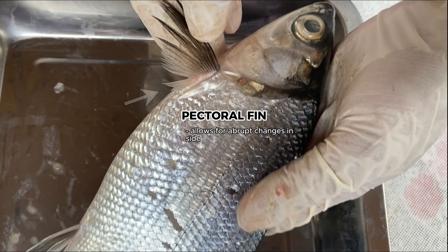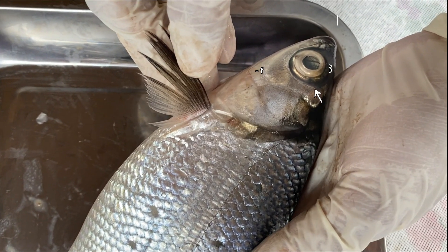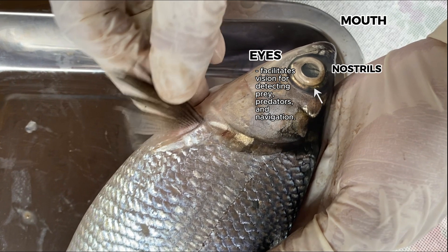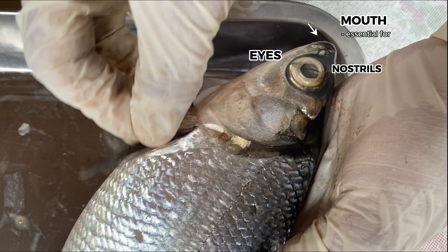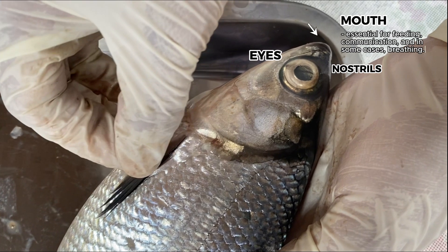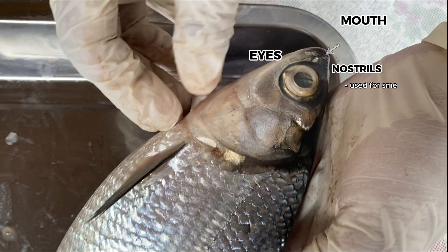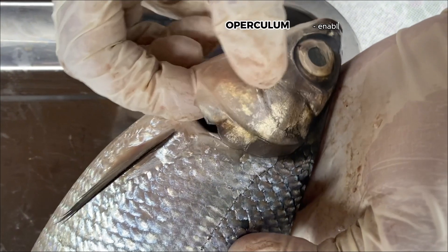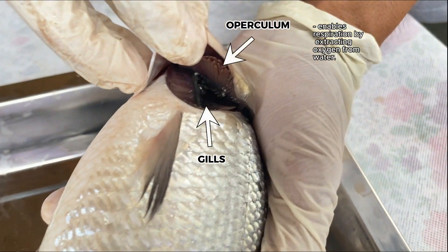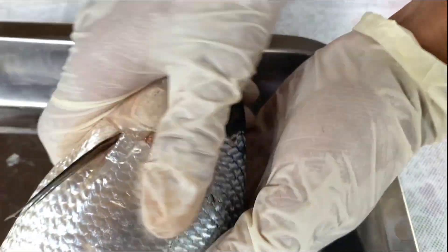Pectoral fins: they allow for abrupt changes in side-to-side direction and speed. Eyes: they facilitate vision for detecting prey, predators, and navigation. Mouth: it is essential for feeding, communication, and in some cases breathing. Nostrils: fish use these for smelling. Operculum and gills: they enable respiration by extracting oxygen from the water.